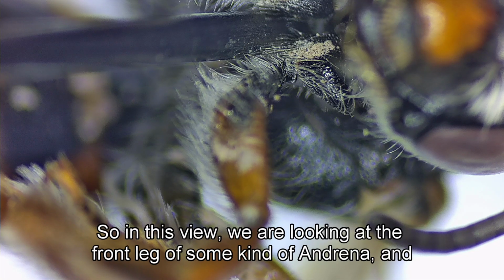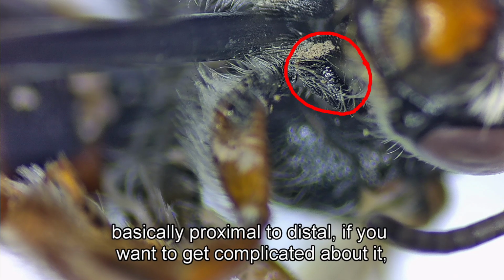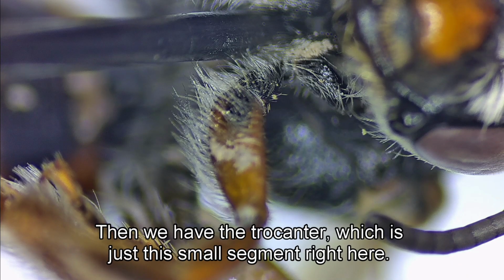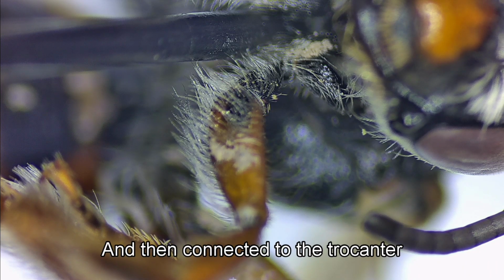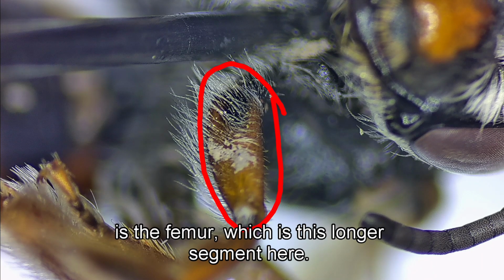So, in this view, we are looking at the front leg of some kind of andrena, starting right here at the top, connecting right up to the thorax, or basically proximal to distal if you want to get complicated about it. We have the coxa tucked way up here. Then we have the trochanter, which is just this small segment right here. And then connected to the trochanter is the femur, which is this longer segment here.